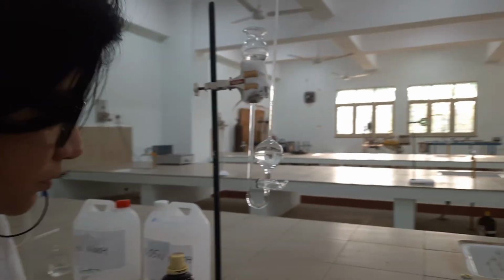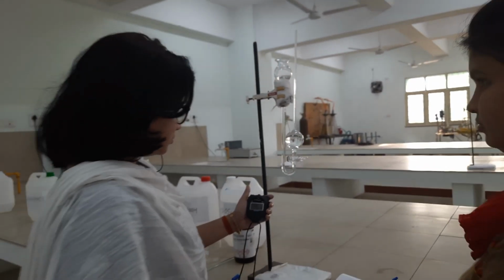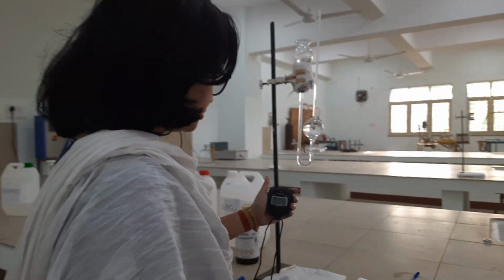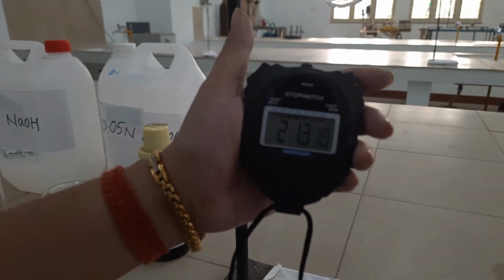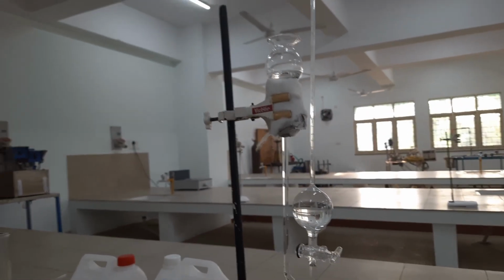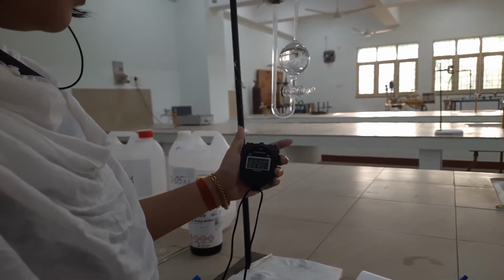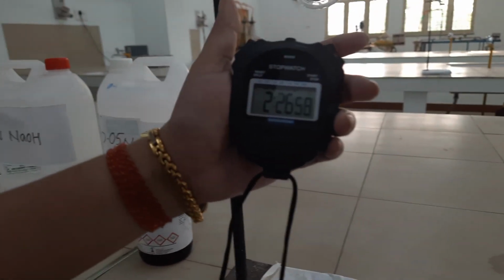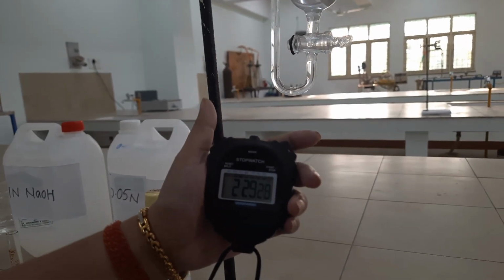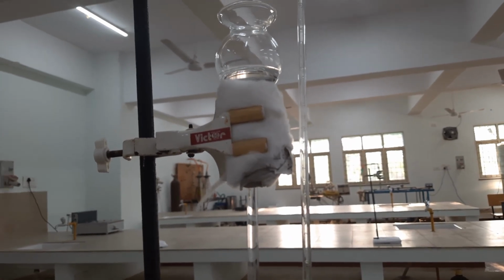We'll note that down. The next reading is 6.1.